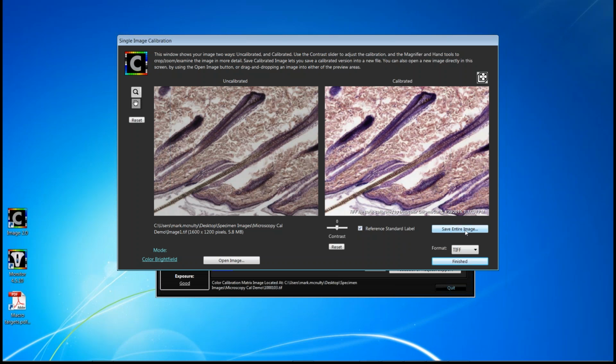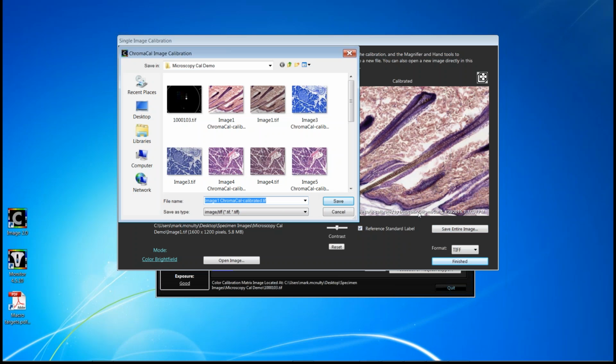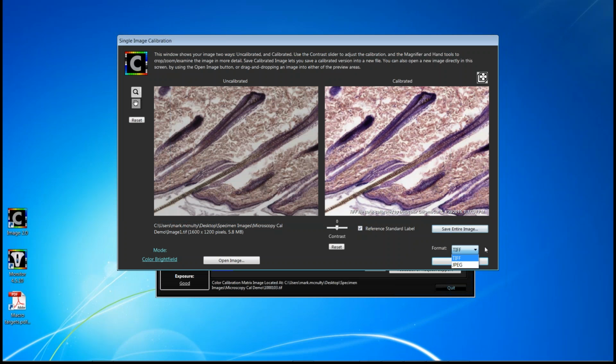At this point, you can save the image. So I'll click Save Entire Image. And just a few things to note here. We save the calibrated image under a different file name. So we take the original file name and add the words CHROMACAL calibrated to the end. We also save the image in the same format that it was provided. So we can process all TIFF and JPEG. So in this case, the original image was TIFF. We can save it as TIFF. We do have the option, though, that you can save that image, if you're concerned about image size, as a JPEG, the calibrated image. But please note, we do not modify at all the original image. We create a copy. We calibrate that copy.